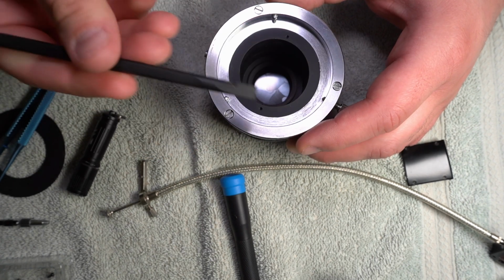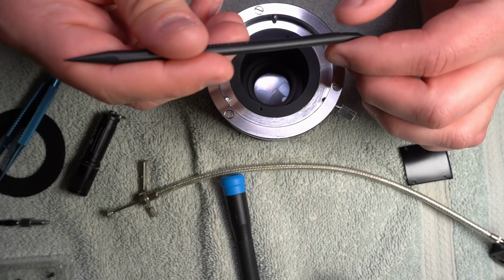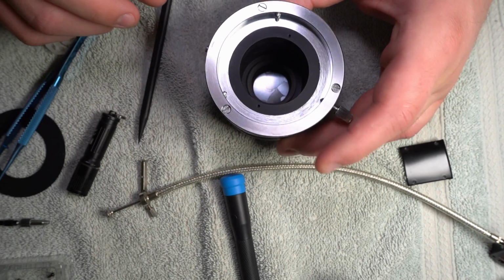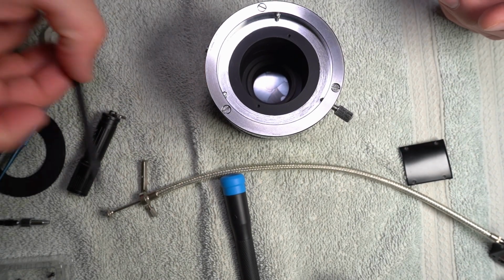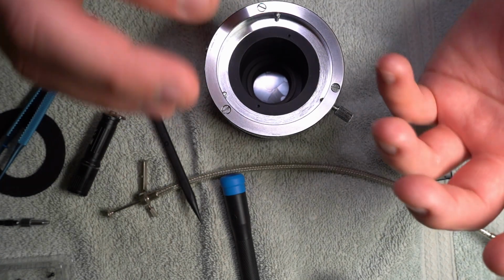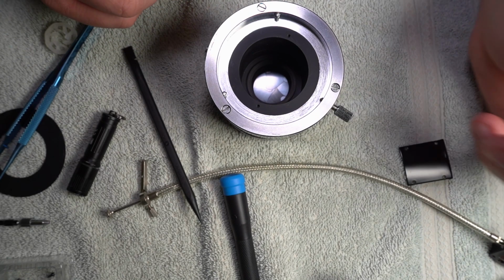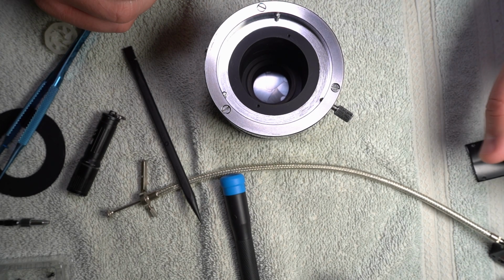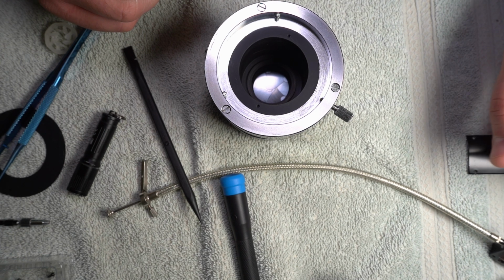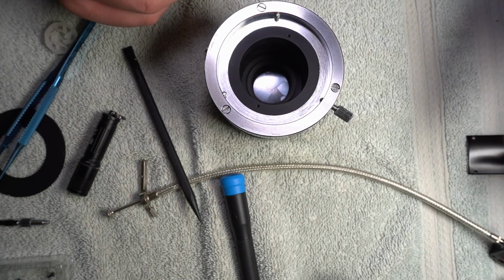Okay, so I've got that screwed on there pretty good. I'm just waiting until this flexes, and then I'm done. It doesn't need to be tight. It's not going anywhere. But aluminum threads are really bad because they gall really easily if you put too much torque on them. Or actually, I shouldn't say that. Well, do they? I think stainless steel is the one that galls really badly. Like it welds itself to things.